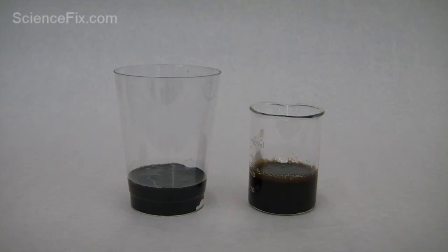Now the color change is pretty much complete. We have a definite black color to both containers. Now something else is going to happen.